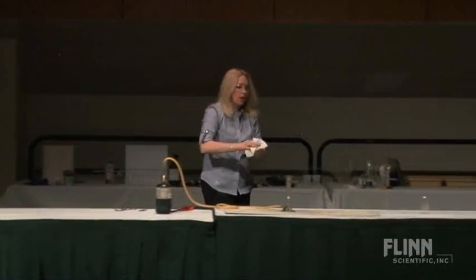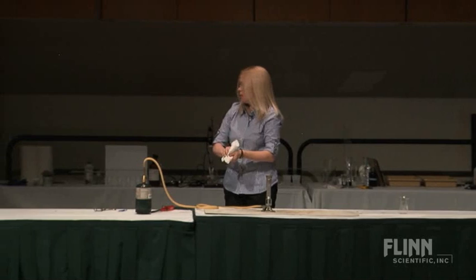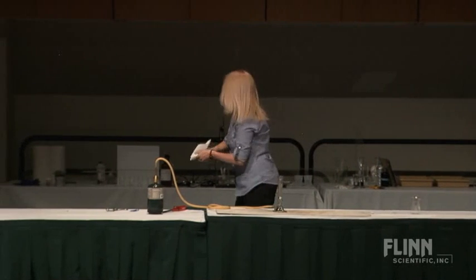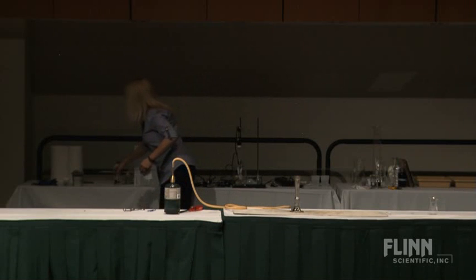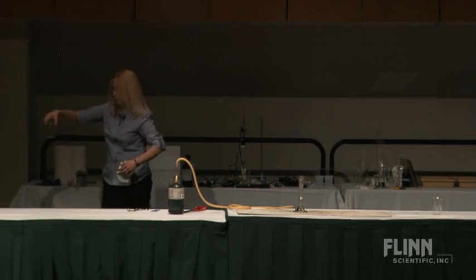I kind of got on a metals kick and I was like, alright, so let's do some other cool stuff with metals. My favorite metal is copper, and so I thought, alright, let's do something with copper for this show.